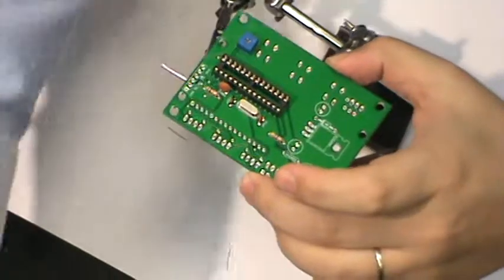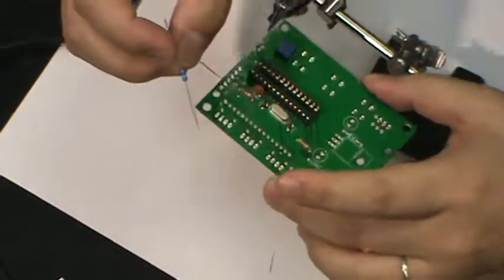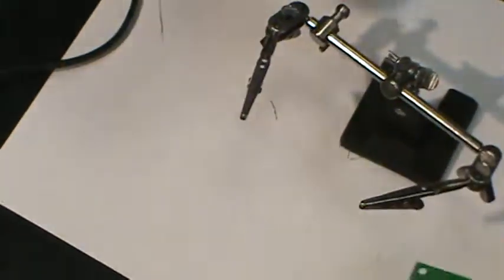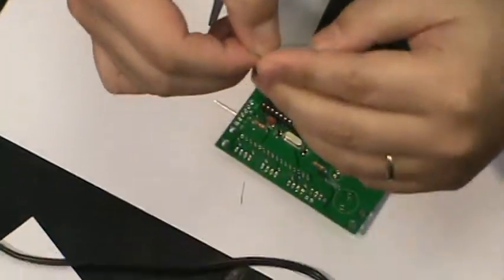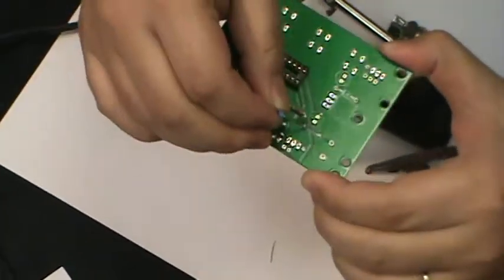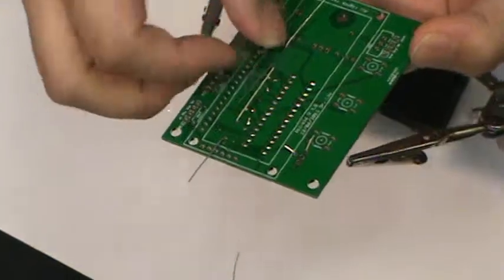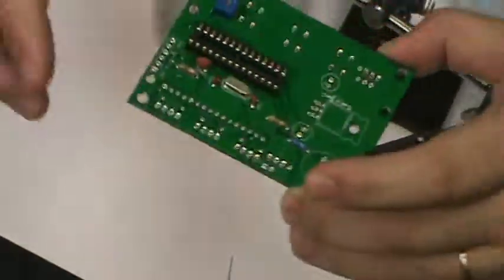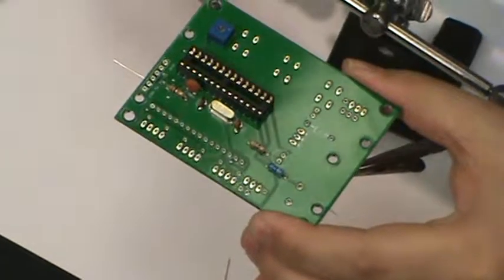Let's see, we need a 330. We actually have a 280. It doesn't matter either because this is for the buzzer. It just determines how loud the buzzer sounds. Just like that. Okay, well, I'm pretty sure we can put a few more pieces here.